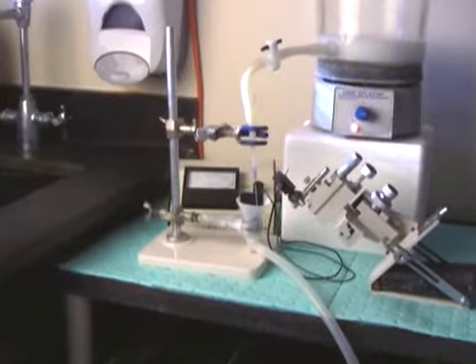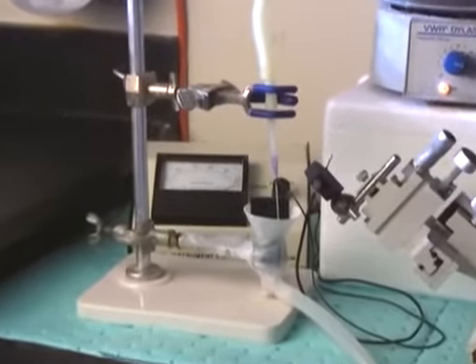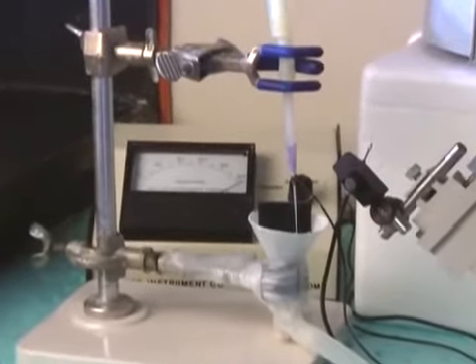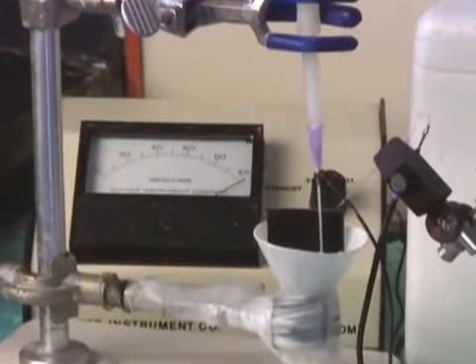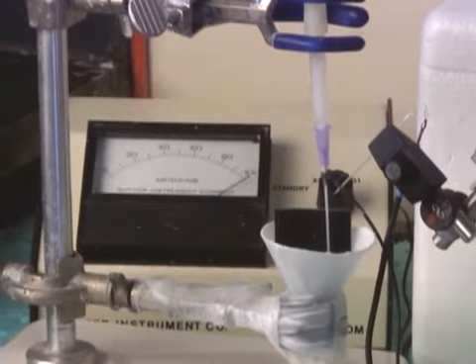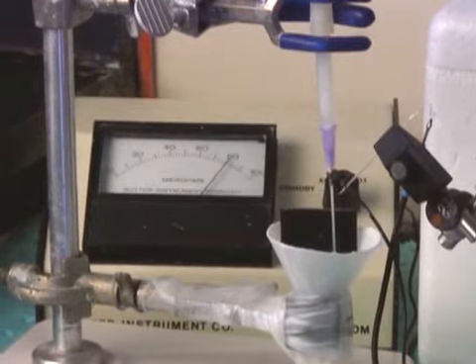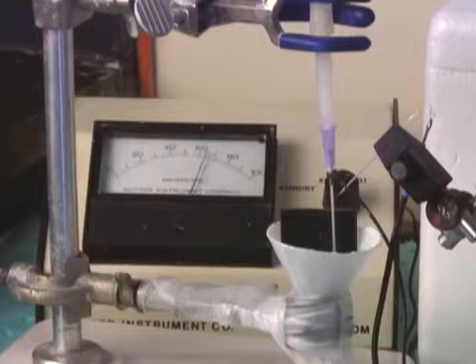We use a custom-built beveler to improve the electrode properties and lower the recording electrode resistance to about 5 megohm. The electrode is held at a 45-degree angle into a stream of an aluminium oxide suspension. Mixing sodium chloride into the suspension and connecting an ohm meter allows monitoring of the electrode resistance during the beveling process.